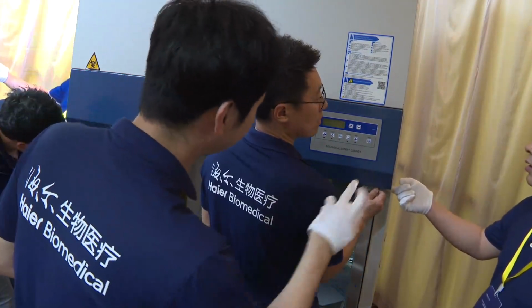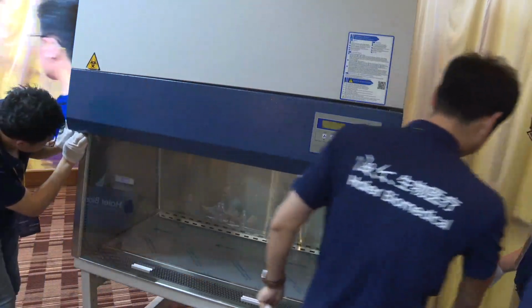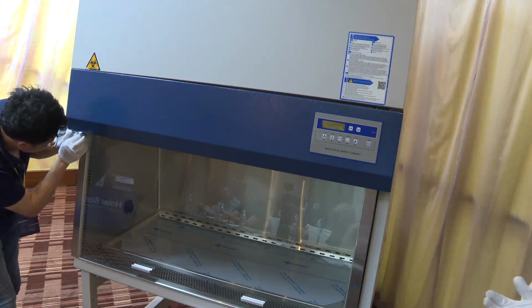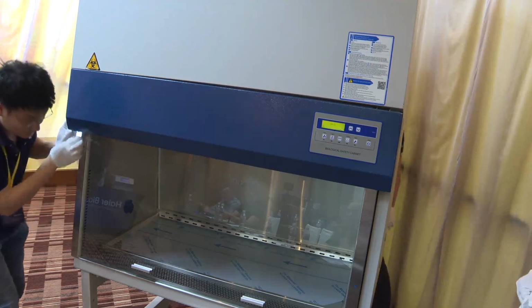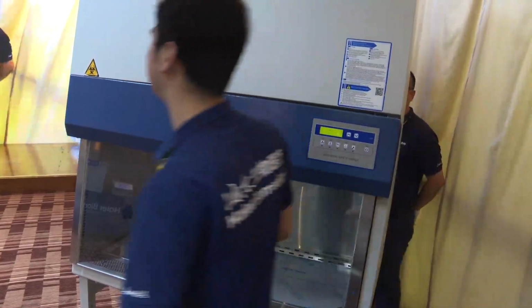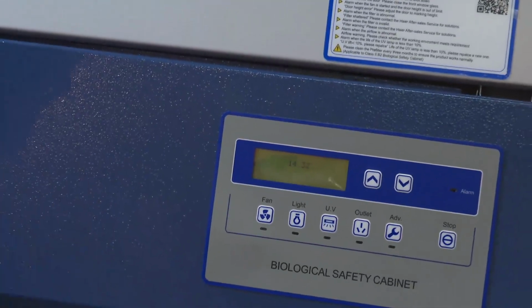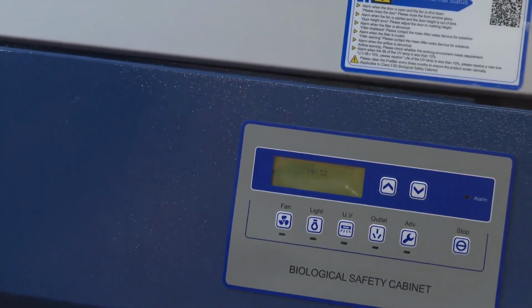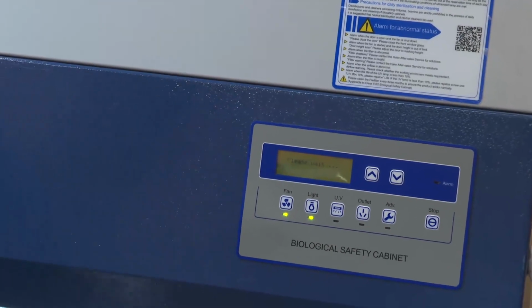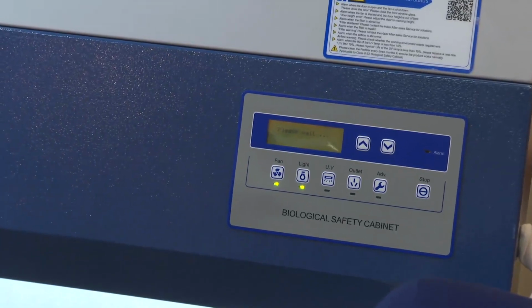Okay, now we have powered this on. Okay, please wait 2 minutes again.